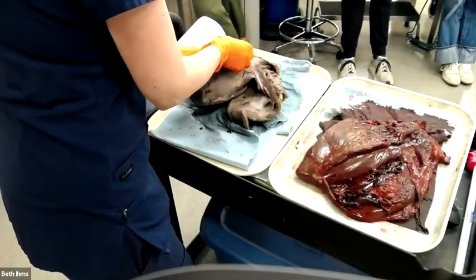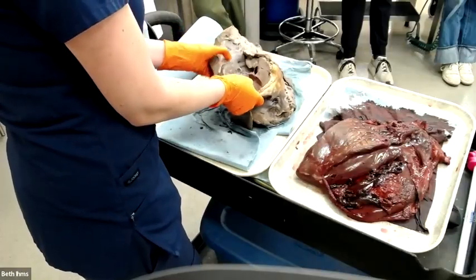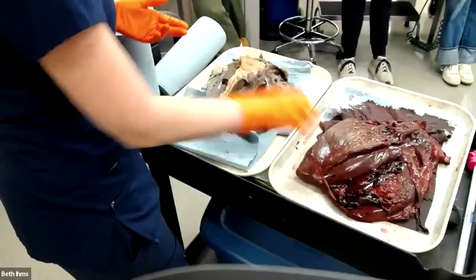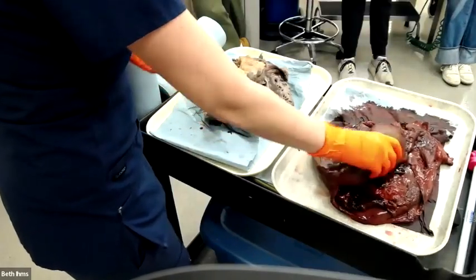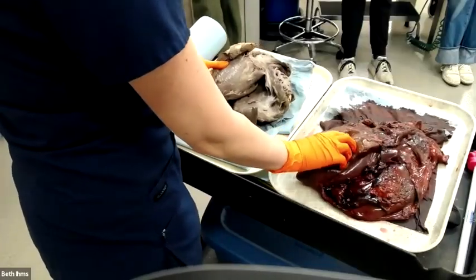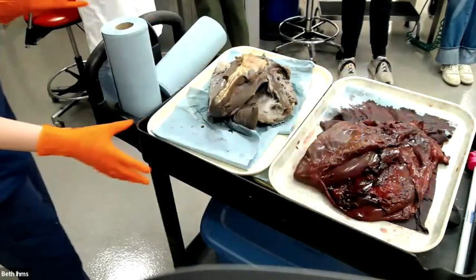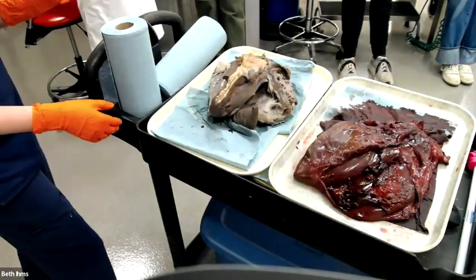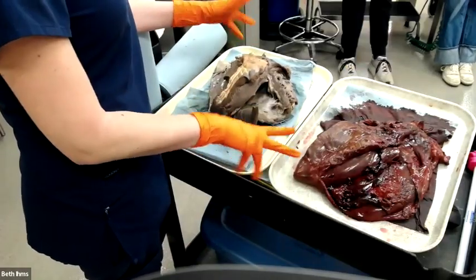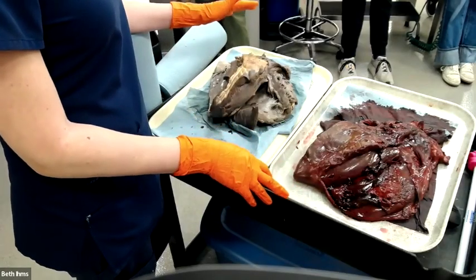This is way firm. So just keep in mind when I show you guys fixed tissues, a lot of the things like texture and color are not going to be representative of what it really looked like when it was freshly dead. This is a freshly dead heart. This is a fixed heart. They are very different, but I need you to understand that I'm going to show you lesions anywhere between here. Does that make sense? And you're going to be like, but the color's weird. I'm going to be like, I know, that's fixed. Makes sense? Any question about fixation artifacts or postmortem changes or literally anything?